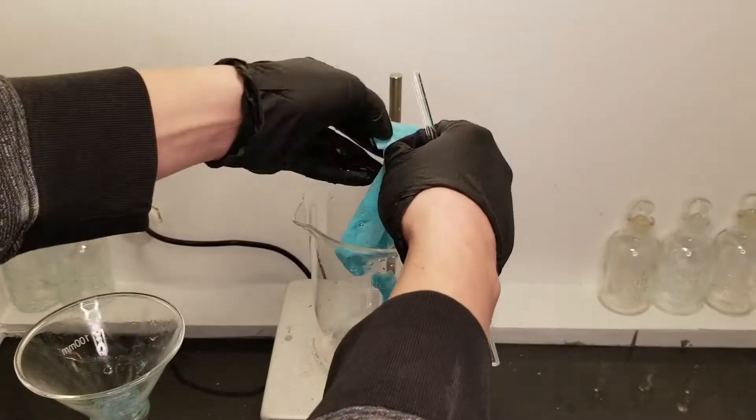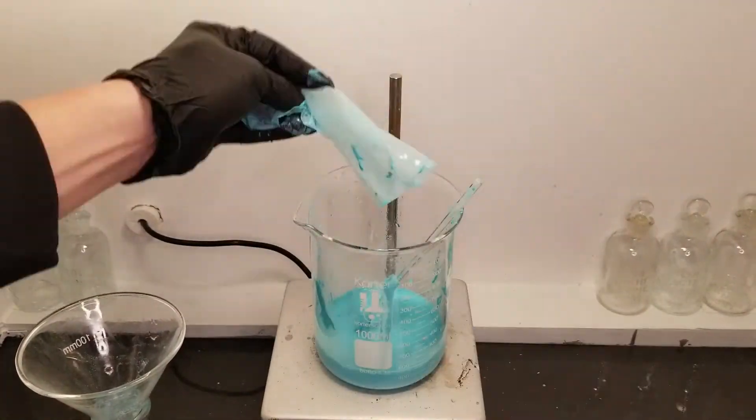Next, all of the copper carbonate is scraped and sprayed off the filters into a clean beaker.